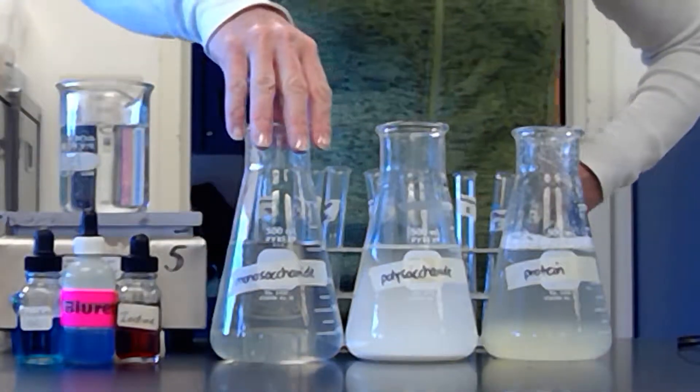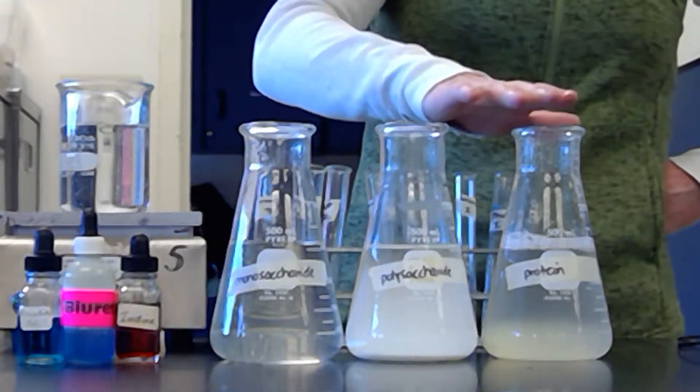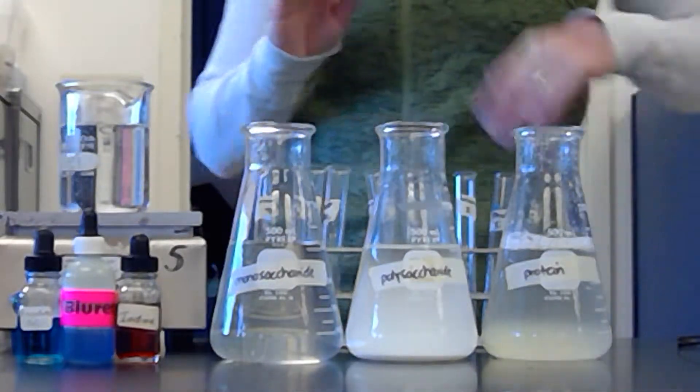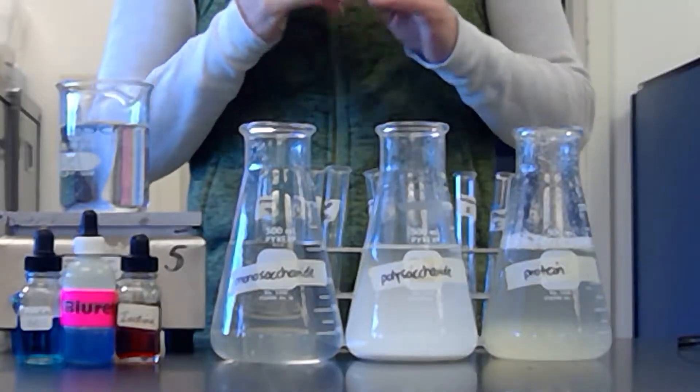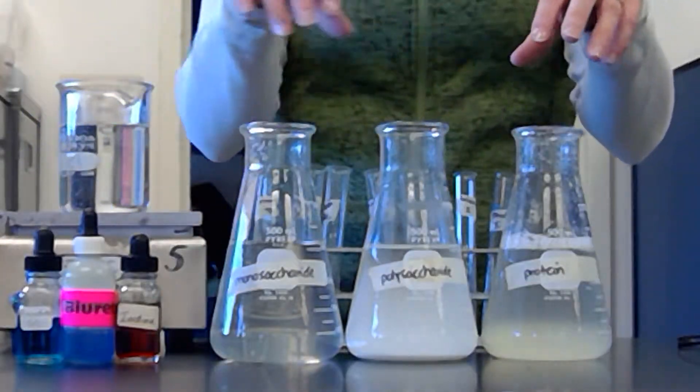And then I have three different solutions. One is monosaccharides, one is polysaccharides, and one is protein. So as we go through these, there's going to be one indicator that is positive for each of the three different things.